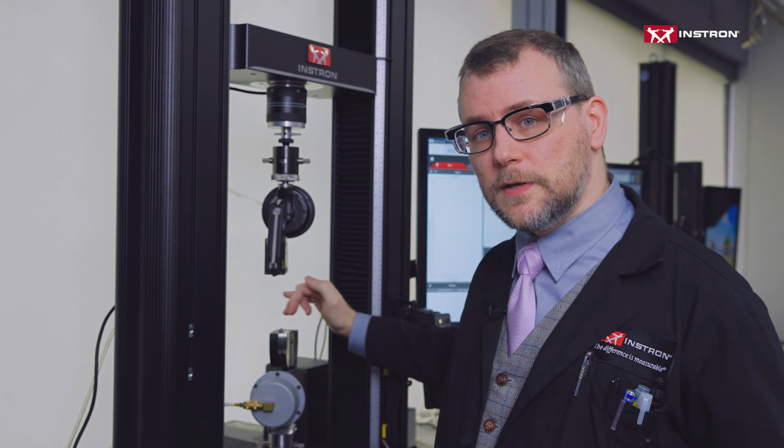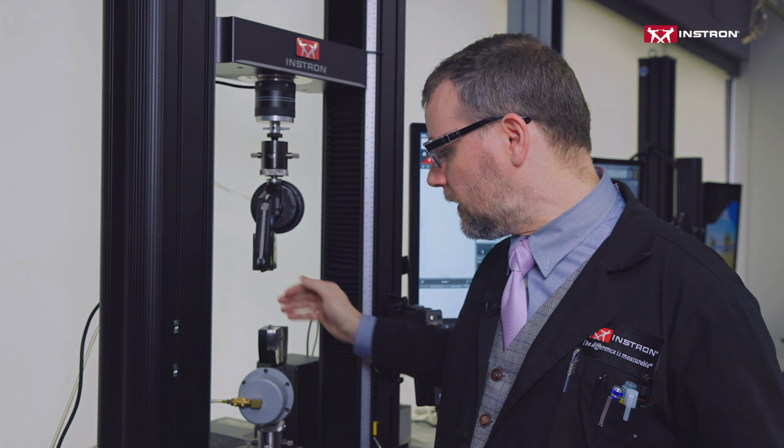You can remove these blocks with screws from the back and a screw from the front for some designs. Making sure that these are clean of oils, residue, debris will help increase the frictional contact between the material and the blocks, and that could really help with any slippage you're seeing.